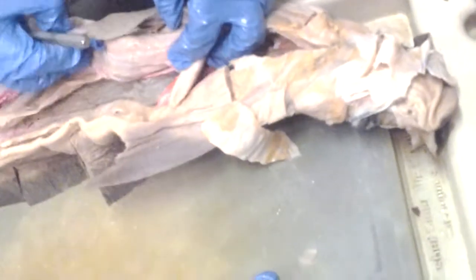Oh, so basically, you have here the celiac. Yeah, let's find the celiac. Okay, so this is the celiac artery. It's very big and red and thick, and you can see if you move this, the other one is thicker because it's a hepatoduodenal ligament.